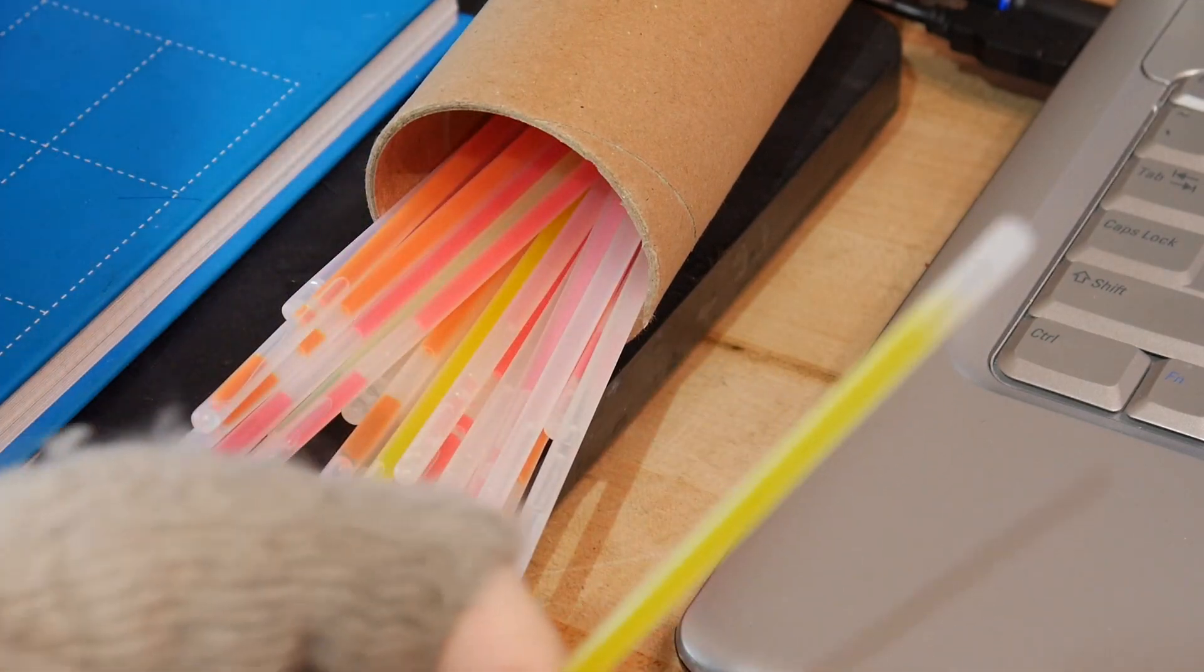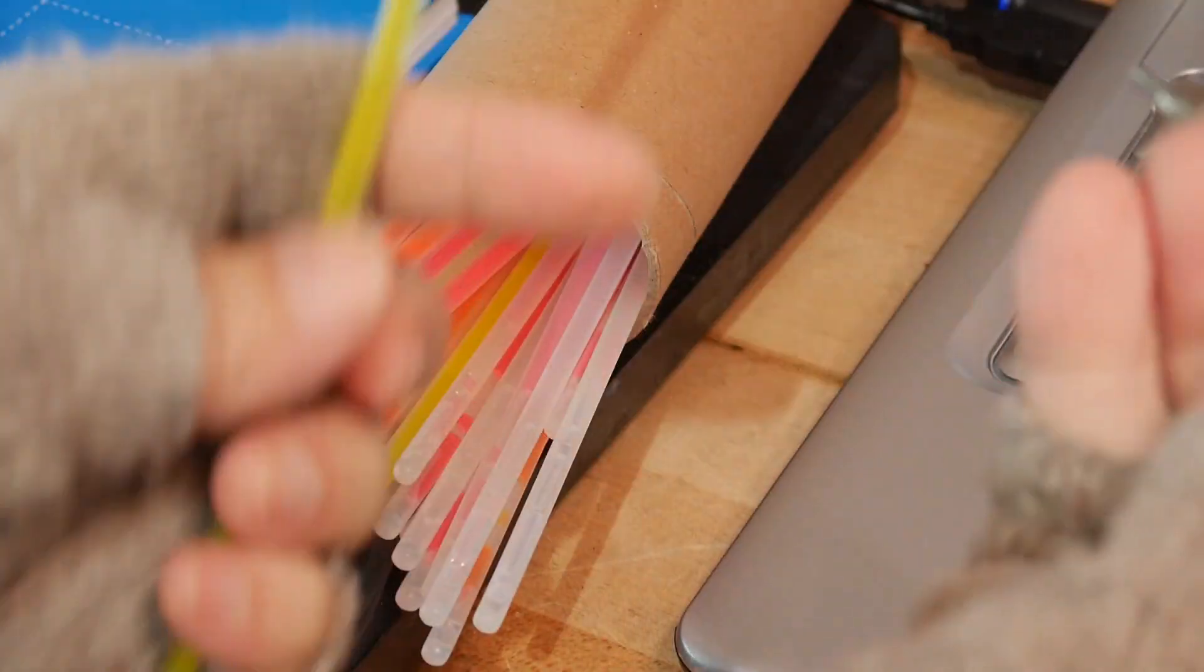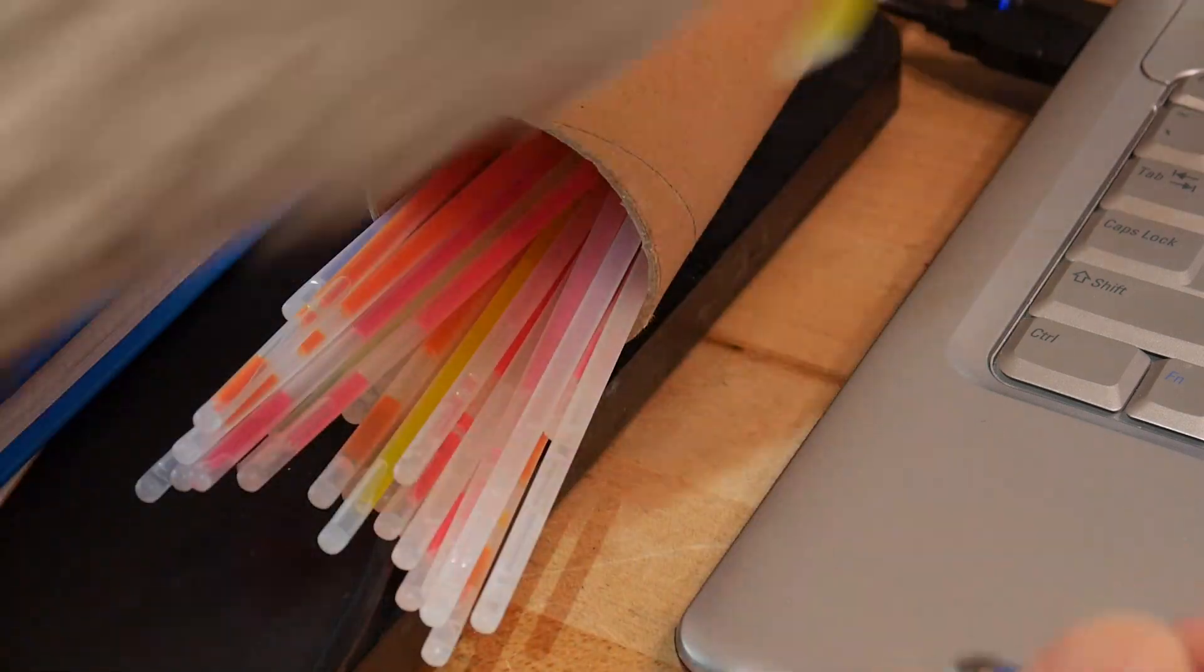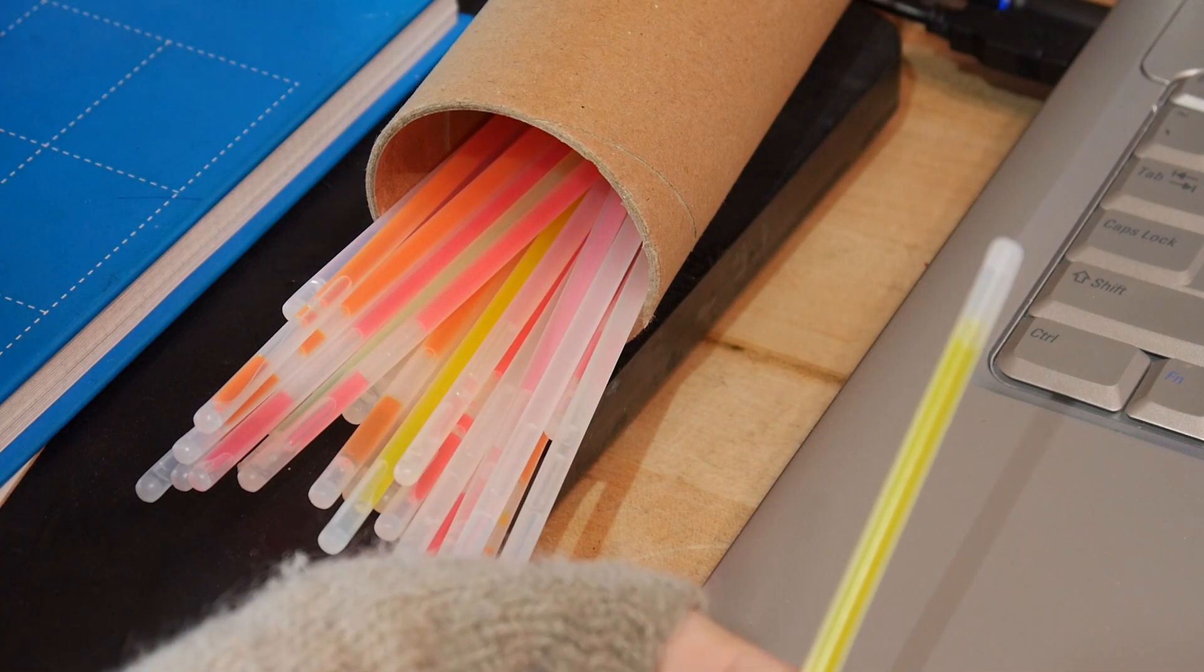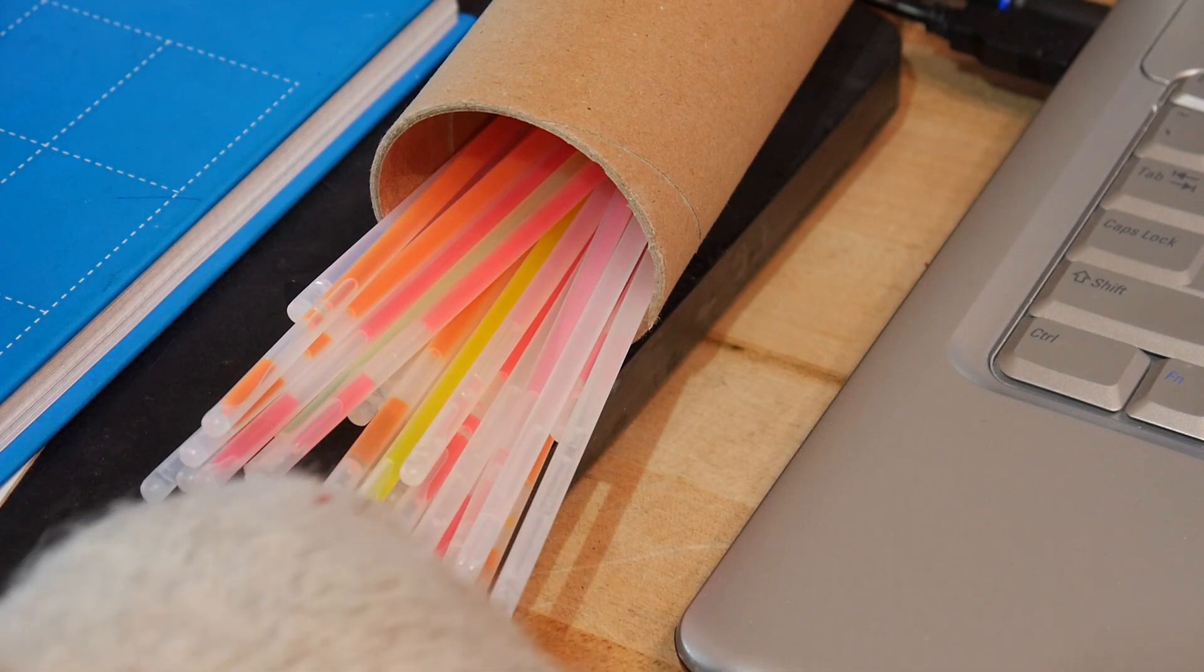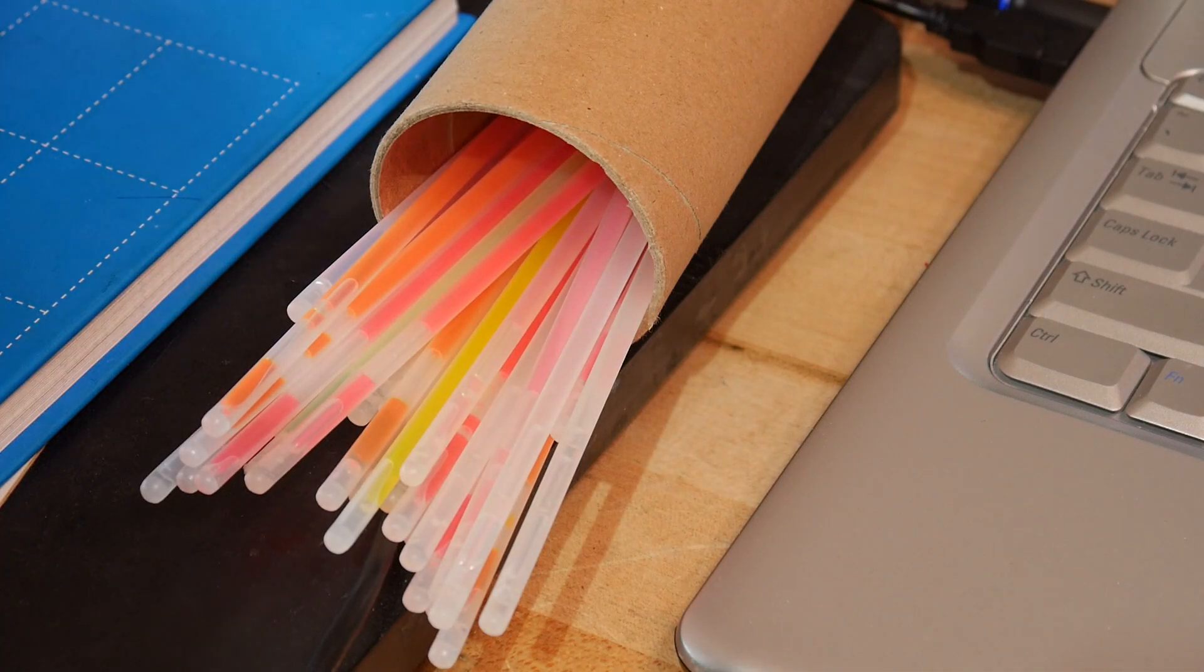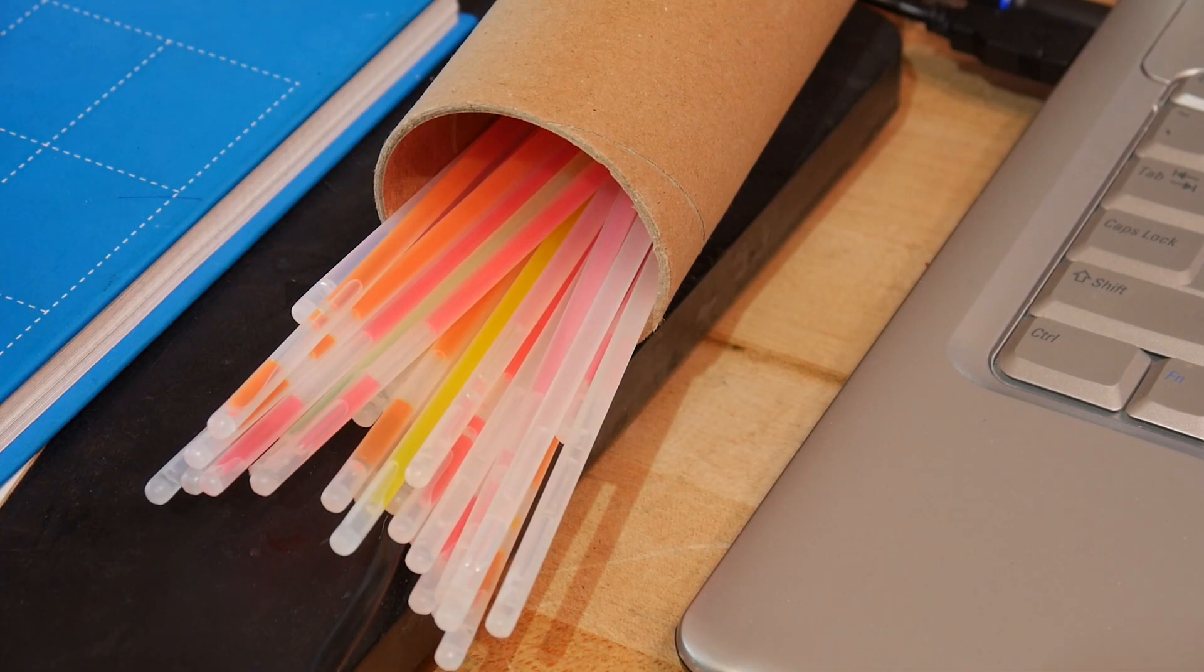We'll use our fiber optic and we can put the fiber optic right next to the glow stick and we will see the spectrum of the light here. So what I'm going to do is before I crack this open, I'm going to turn off the room light so we don't have any ambient light, and then we'll get to measuring these things.